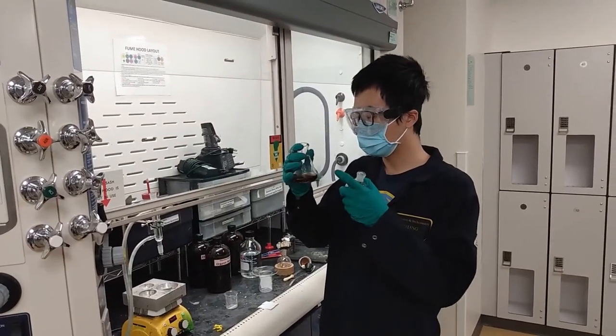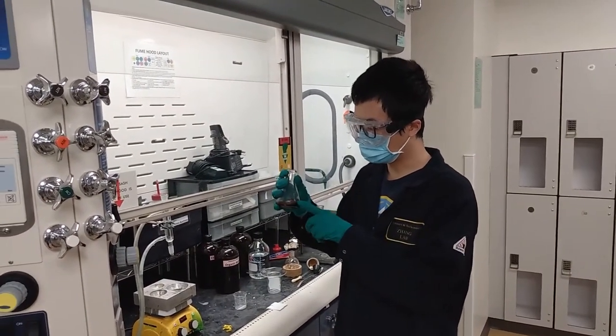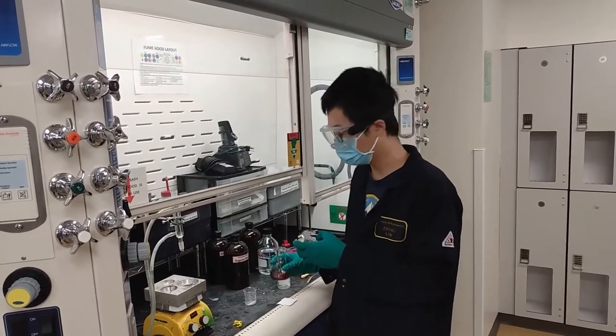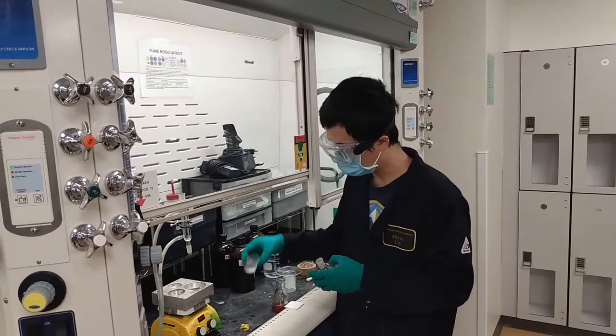Now we got the DCM with our mixture in it. Next we're going to rotovap it down with silica gel.